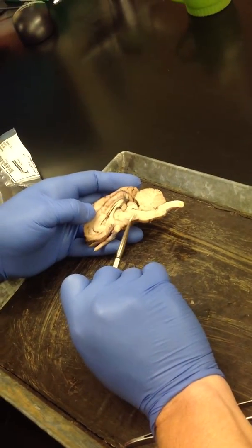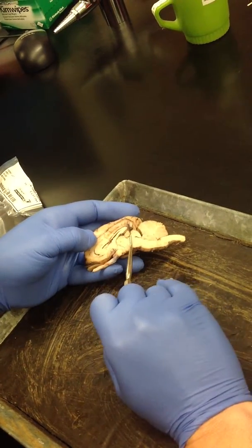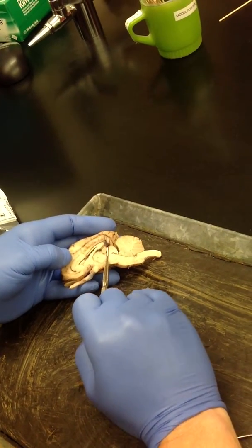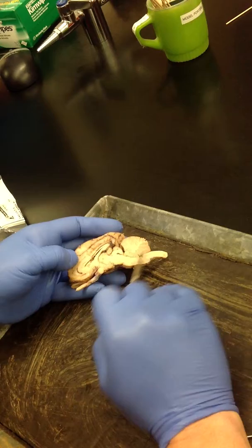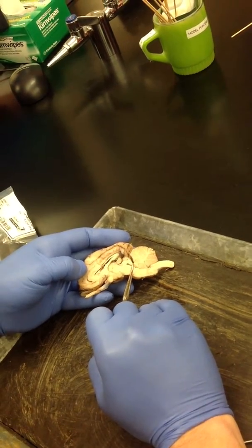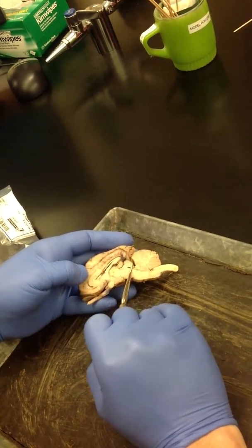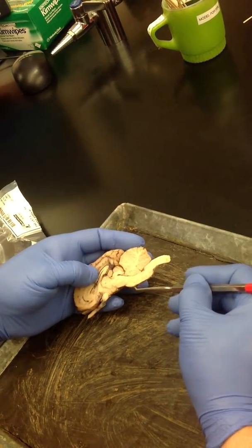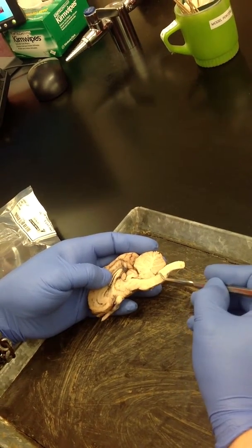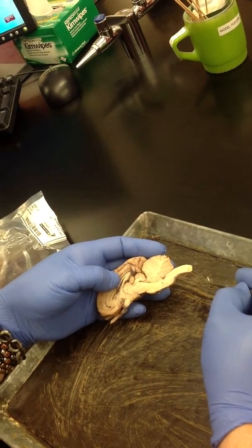So next we go into the brainstem, and that would be from, let's say, here, kind of angled, because this is part of the hypothalamus. That's the mammillary body. So it kind of goes like this, down is brainstem. From here to here is the midbrain, or the mesencephalon. This first bulge right here is the pons. And then down here is the medulla oblongata, and then you go into spinal cord.